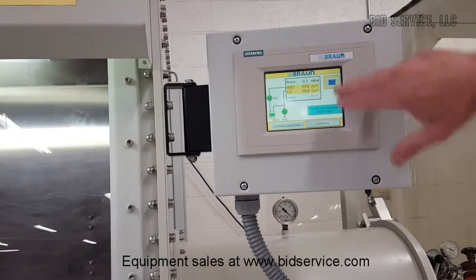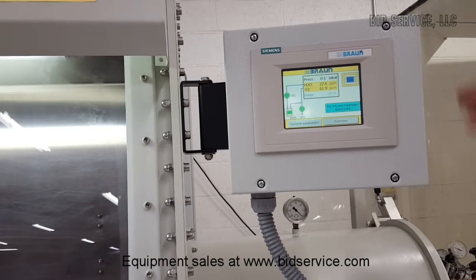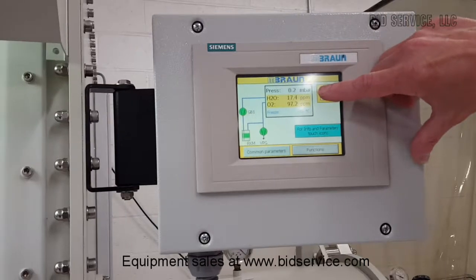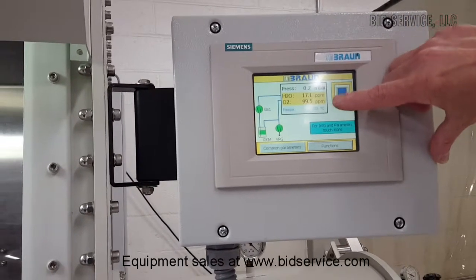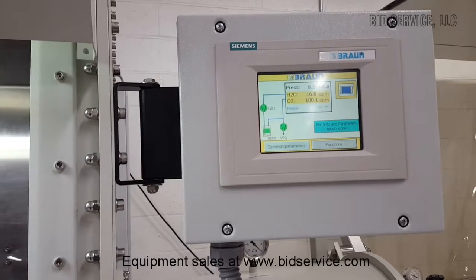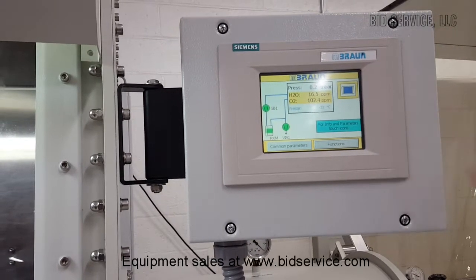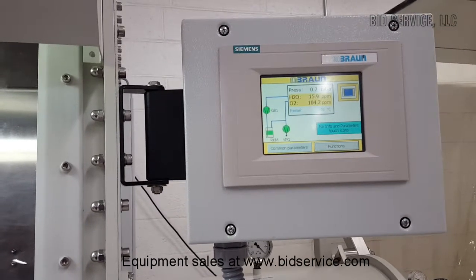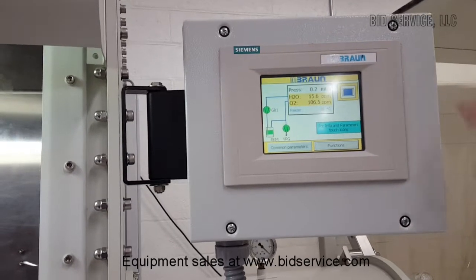We'll come back when this peaks out and then we'll show you that it will clean it up using the purifier. You can see that the water vapor is starting to come down. The oxygen is still rising, but this does show that the gauges and sensors are working. We'll come back in 15 to 20 minutes and show that they're both cleaned up to less than one part per million.